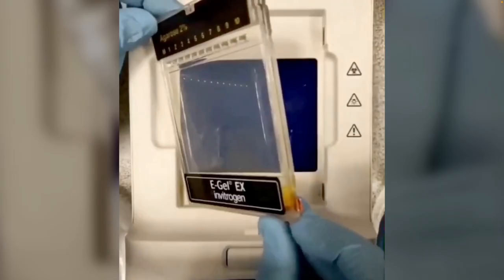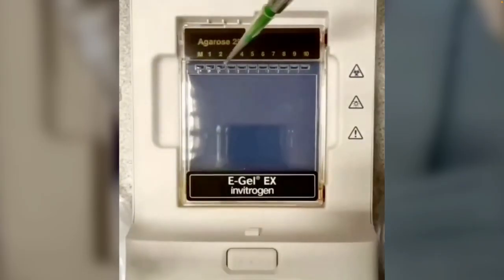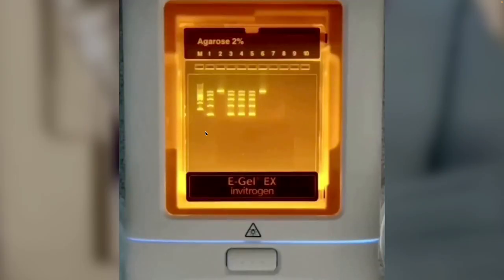In this case, this is gel electrophoresis. It's a laboratory technique that is used in many labs all over the world in drug development and developing new drugs. For those of you who do not know what gel electrophoresis is, I found this little video on my LinkedIn where you see the scientist is pipetting into these wells, and they could be pipetting DNA, proteins, or RNA, and what they do is they apply electricity to it, and depending on the size and the molecular weight or molecular mass, they will travel at different speeds, as we know from physics. So that's what's happening there.